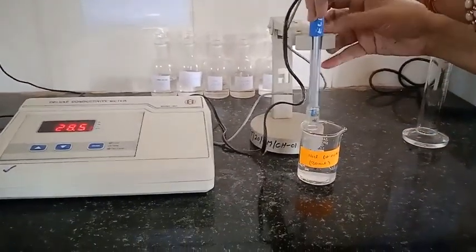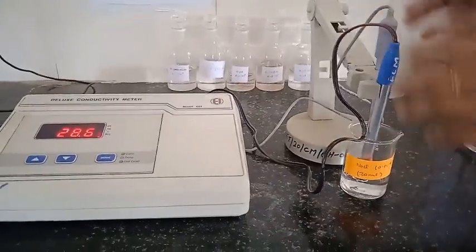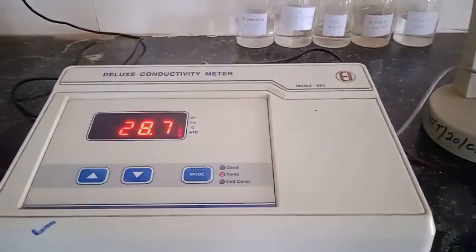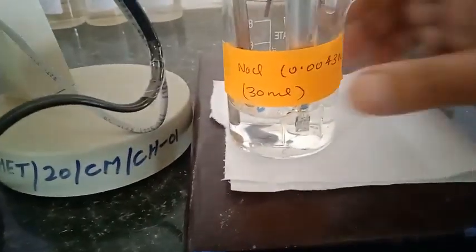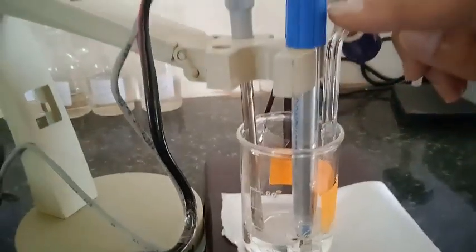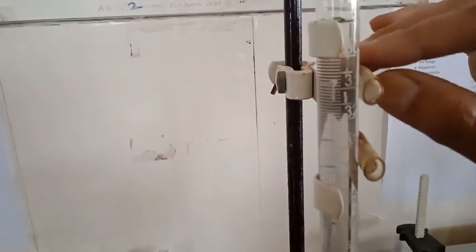Now you can see the conductivity cell and temperature probe are dipped in the solution and placed at the centre of the beaker. Now we are taking AgNO3 in the burette and the volume of AgNO3 I have taken is up to 29 ml.